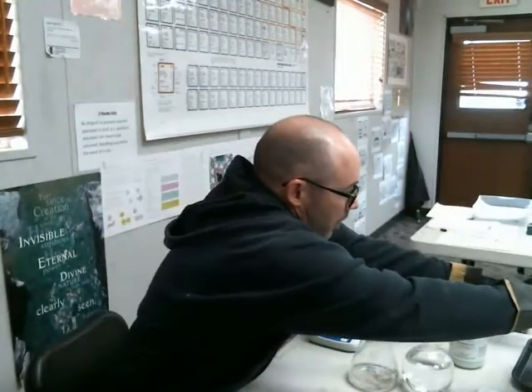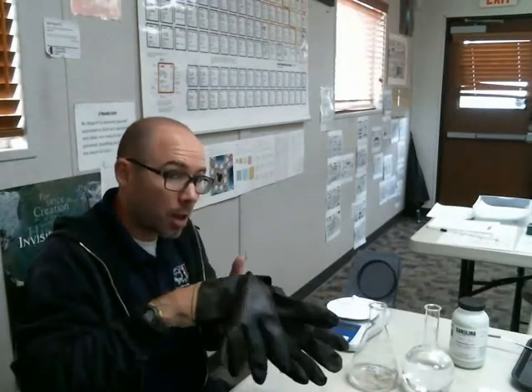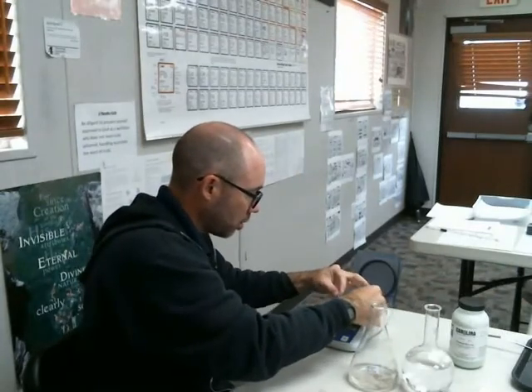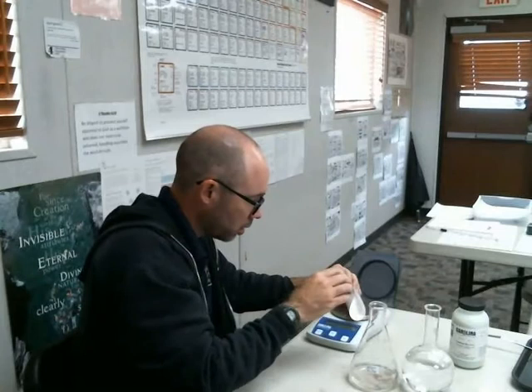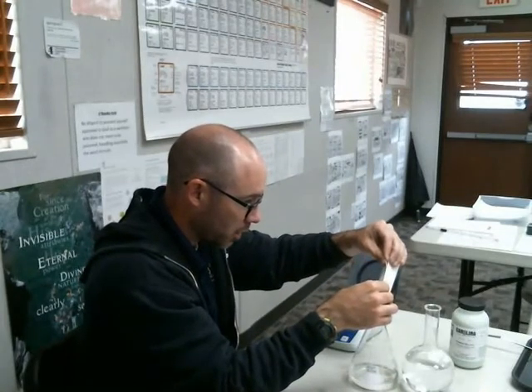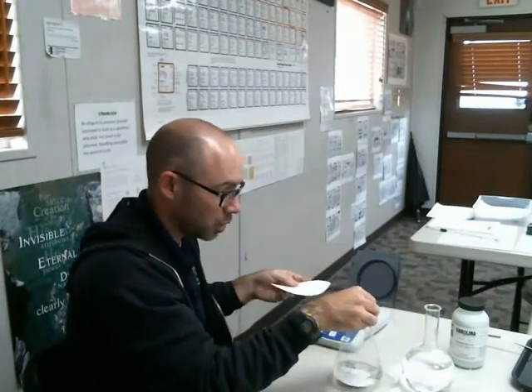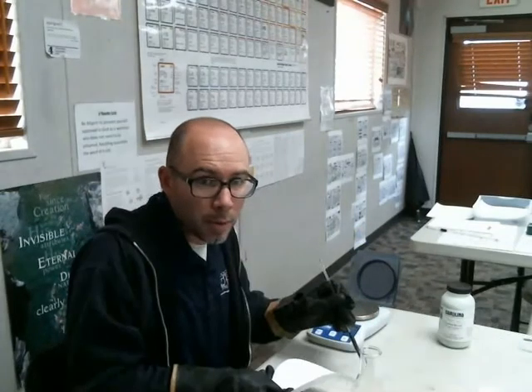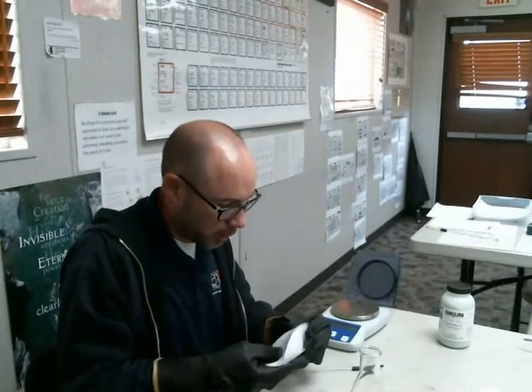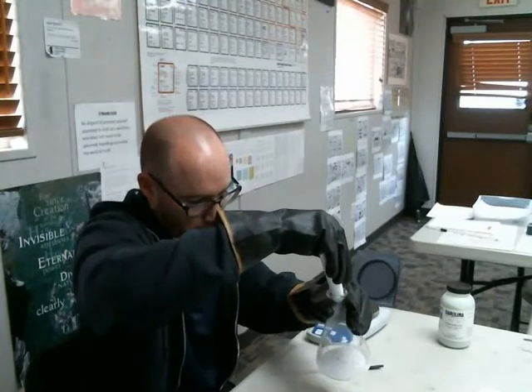Okay, so I start off by putting some water in there, but obviously not enough. Unglove it now. Probably, I don't know, stupid or not, but there we go. And we're going to funnel this stuff down into the water. Oops. What else is a rubber policeman for? When you make messes, right? Got gloves on again. All right. Mostly the rest of it. Pretty safe this time.